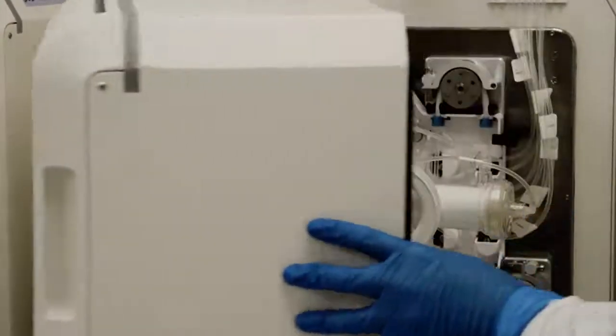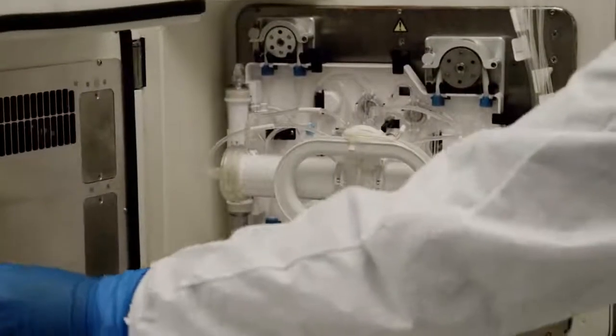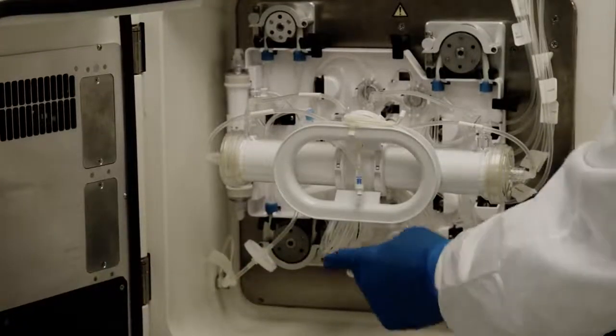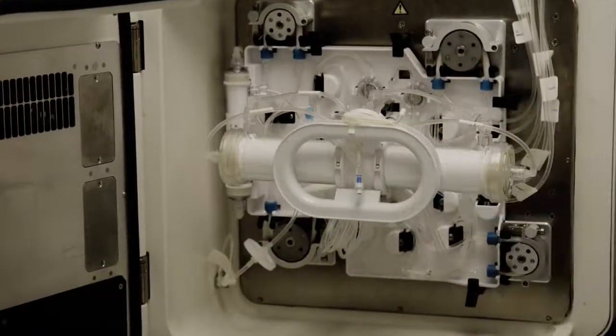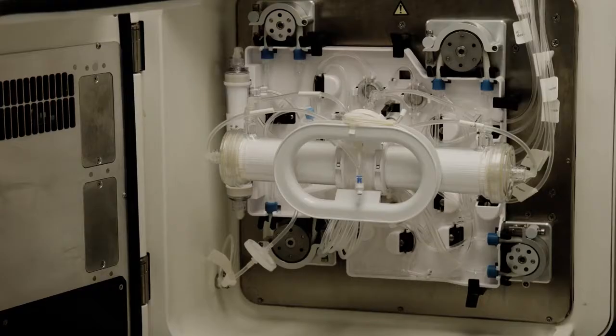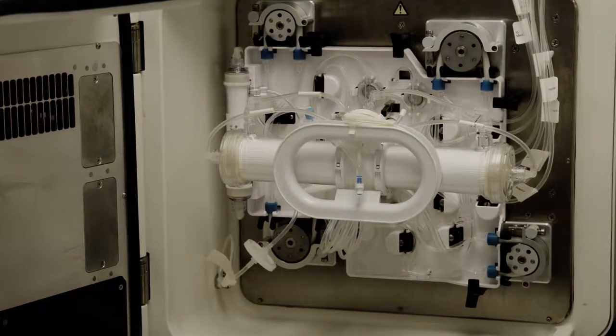Let me open up the device. Here there are four pumps and 11 valves throughout the system that control the sources of fluid and the rates of flow throughout the entire tubing assembly, depending on your protocol.